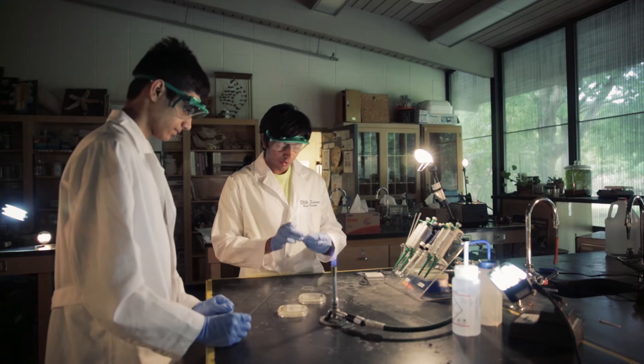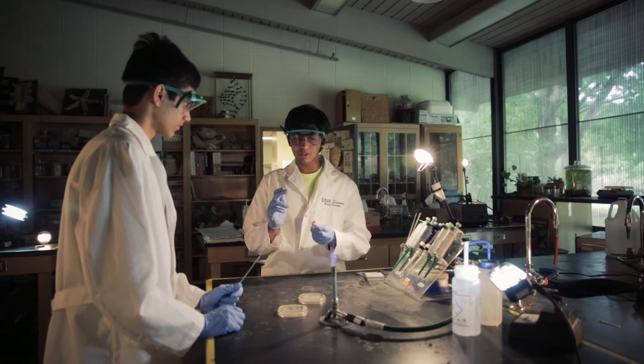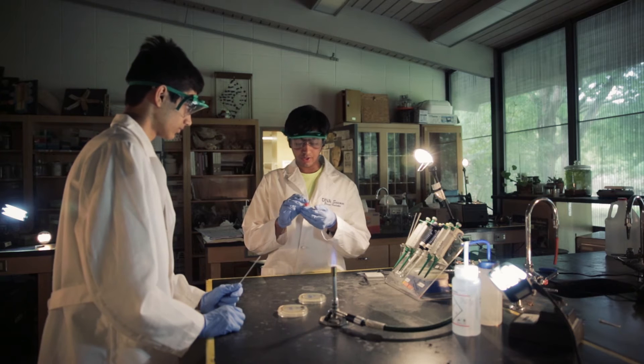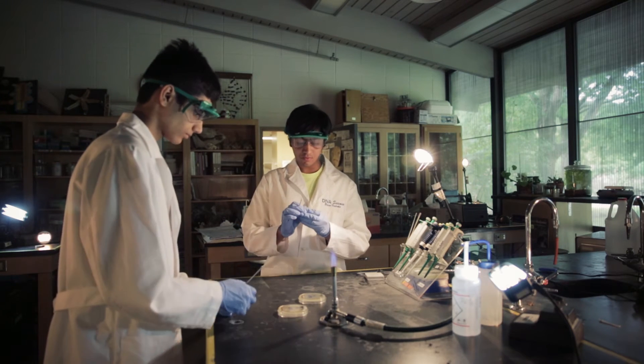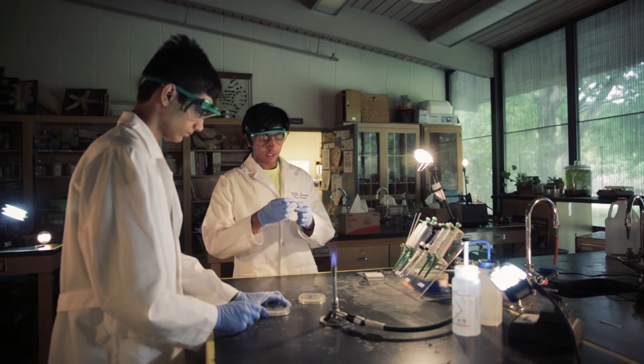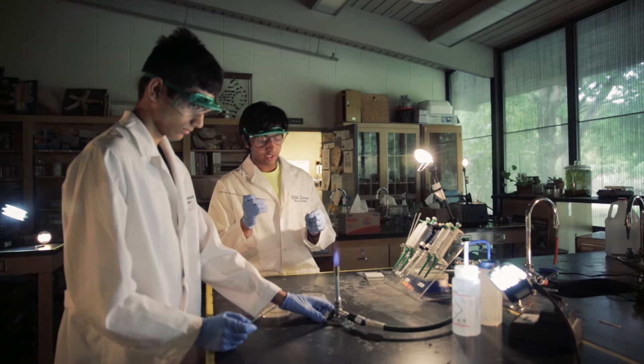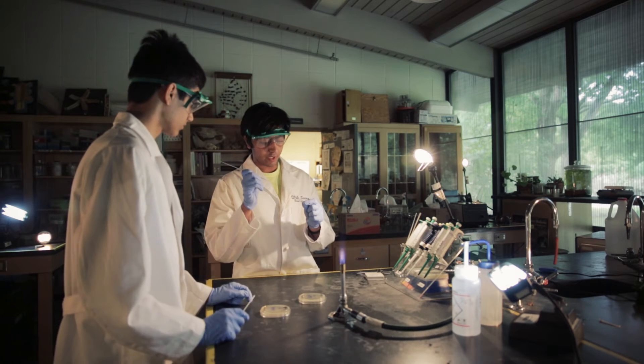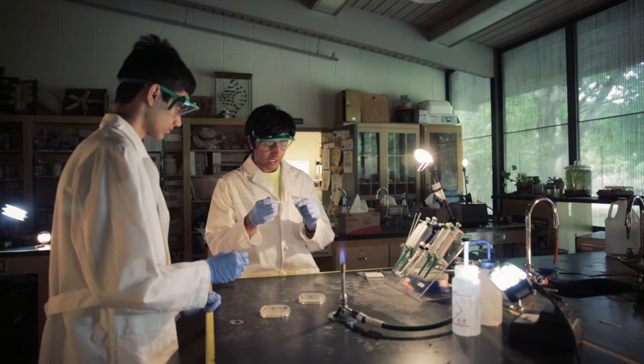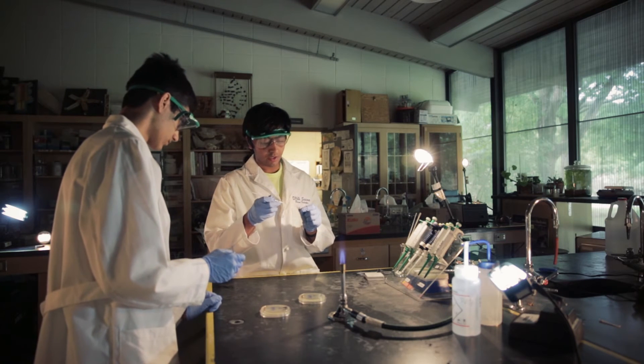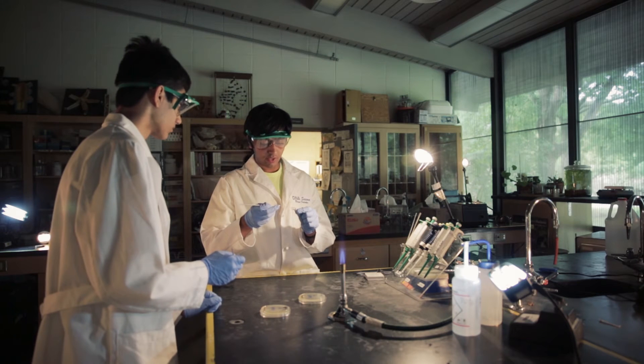Okay. Now that we have this, we can take up the part A, let it cool for a little minute so we don't burn the bacteria. Burn our E. coli right here. And we can open this up. And this is all surrounded by agar. So what we need to do is we need to take this loop and put it right in the middle. And that's where the bacteria are going to be. So we take it right here. Make sure we get a little.